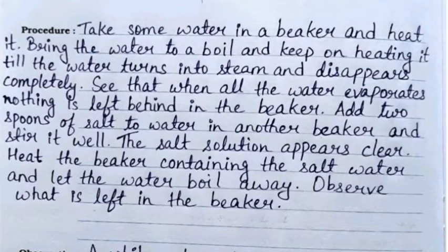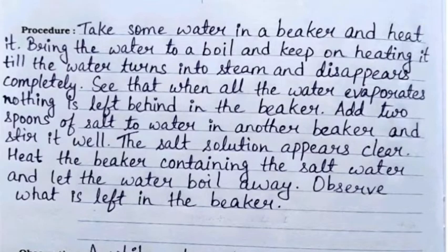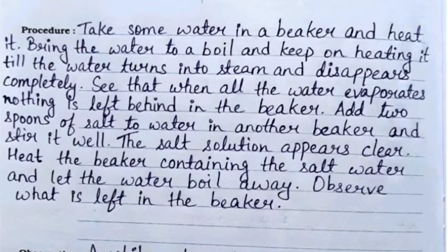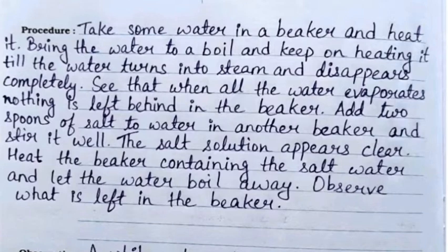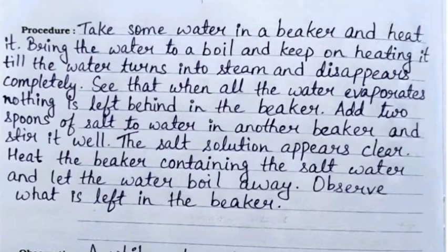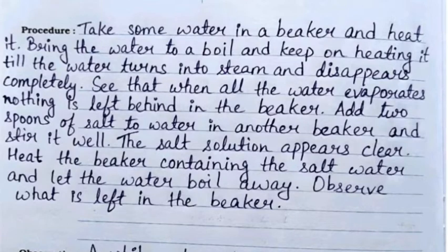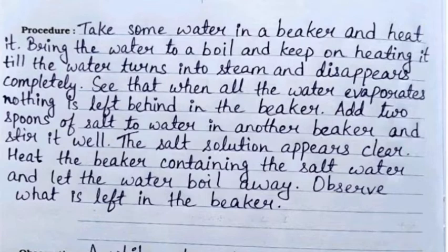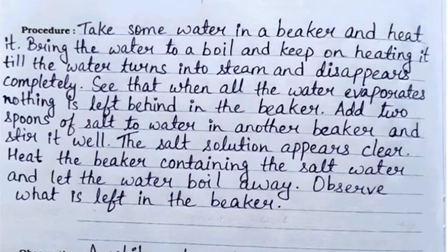The procedure is: take some water in a beaker and heat it. Bring the water to a boil and keep on heating it till the water turns into steam and disappears completely. When all the water evaporates, nothing is left behind in the beaker.